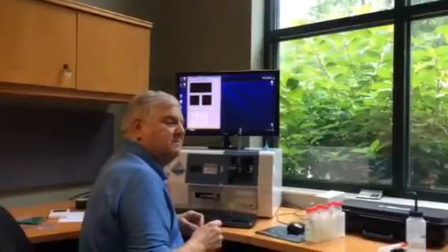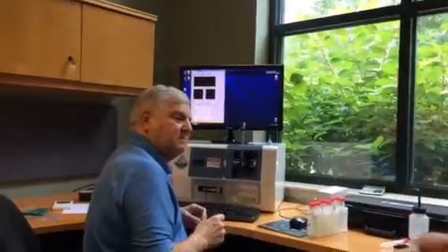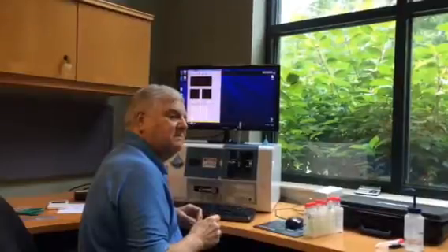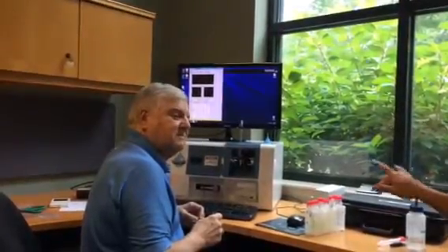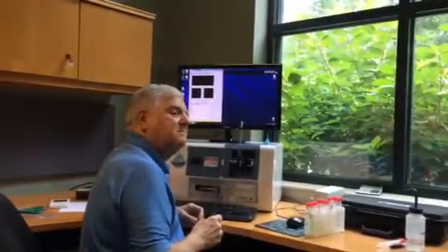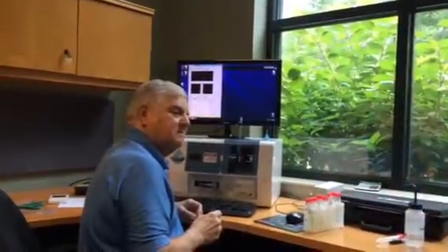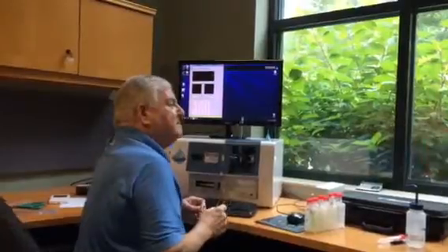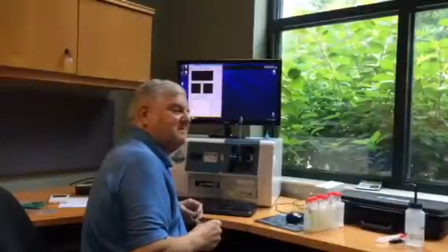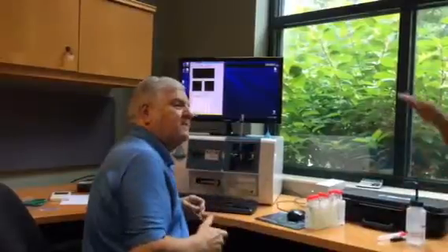Right. And so is it worth using that little trick I showed you yesterday where you go ahead and open auto image, build your notes, write out what the file name is going to be, and the notes are saved. Yes, right. So then hit Control-C, copy that file name, cancel auto image, go back to setup and focus, aspirate your sample so it's inside the top of the flow cell, and then begin. So I'm adding a step, but I'm adding it because I'm avoiding at all costs you getting into the habit of introducing your sample and then getting distracted and your sample settling.